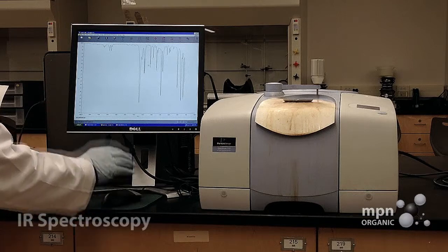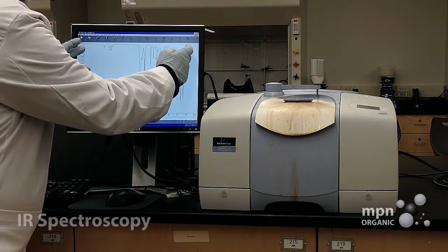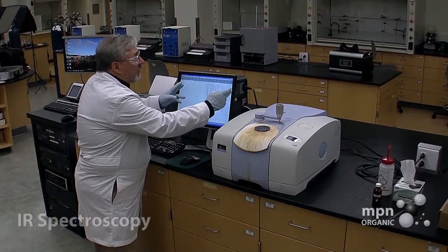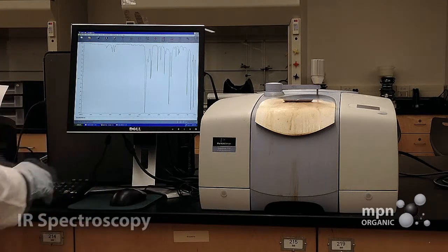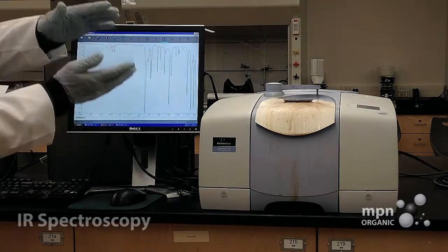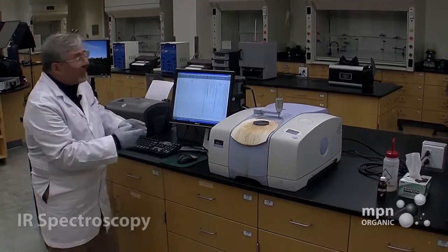And now we're going to prepare it for printing. First thing we're going to do is we're going to expand the x-axis so that it goes from left to right in the extreme. And we do this with opt view. And there you go. You can see that. Not only does it expand in this direction, but also in the y direction as well. All right, so now we want to know where these peaks are.